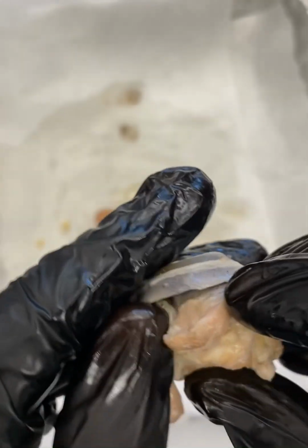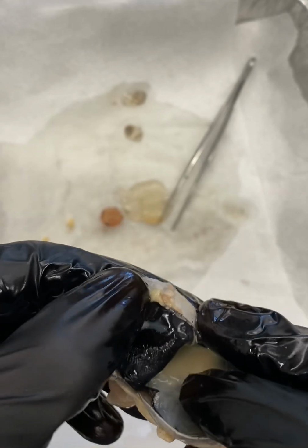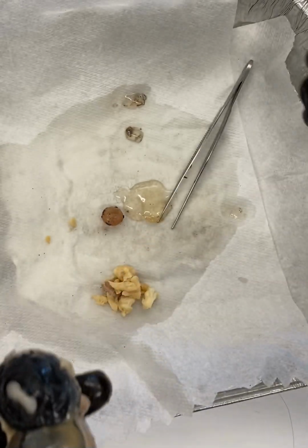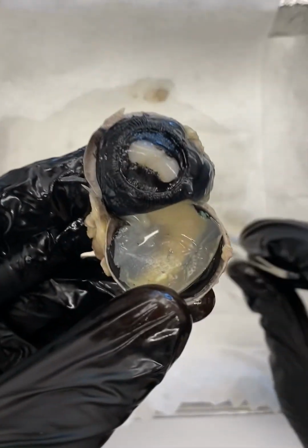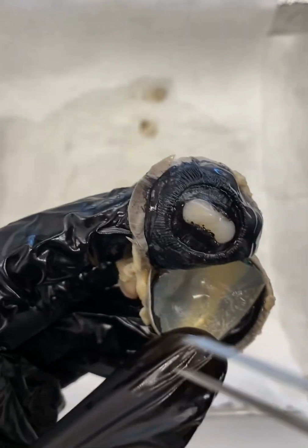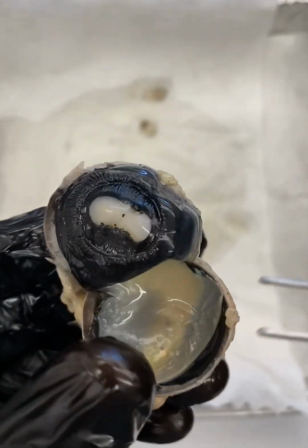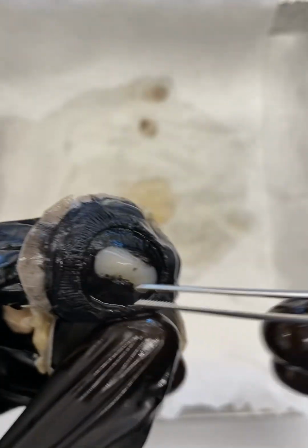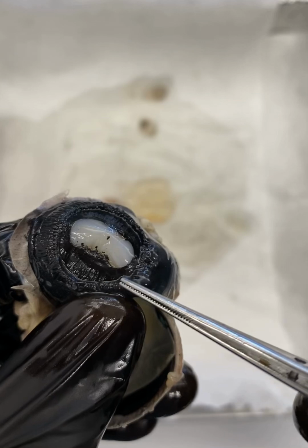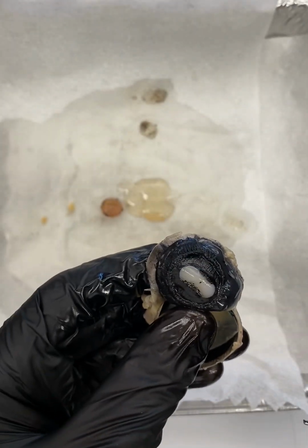So if we continue looking at the anterior, the inside view, but looking anterior, if we flip this eye out a little bit, you can see it a little bit easier, okay? So one thing you see, again, is our pupil, right? Here's our nice pupil with the cornea in front. Iris would be off to the side, okay? Now, we also have what's called the ciliary body. You can see this structure radiating all around the eye, all out here. This is something called the ciliary body, okay?